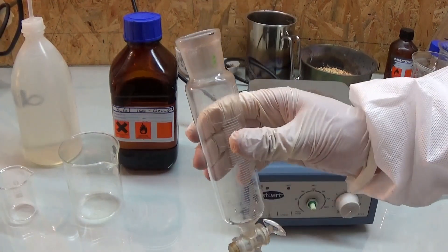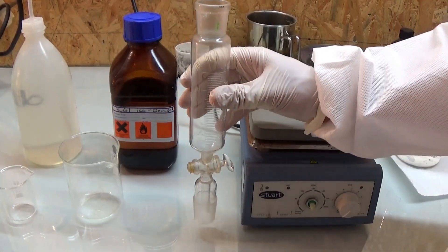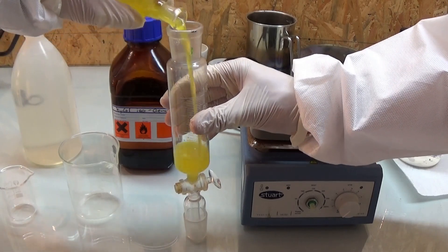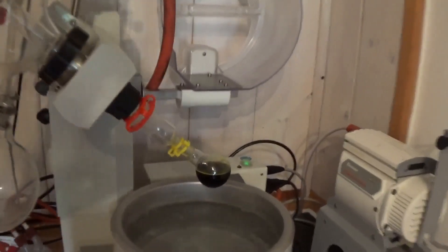Sadly I forgot to film this part but if you like to see how an organic substance gets extracted using a non-polar solvent you can watch my video on cinnamic acid synthesis part 2.